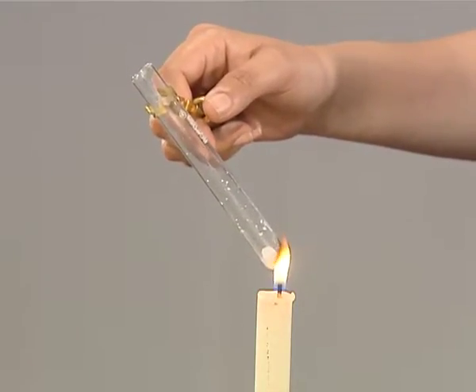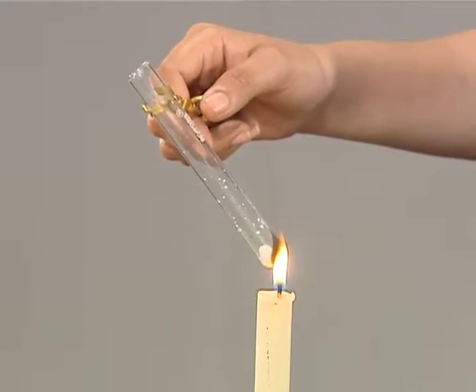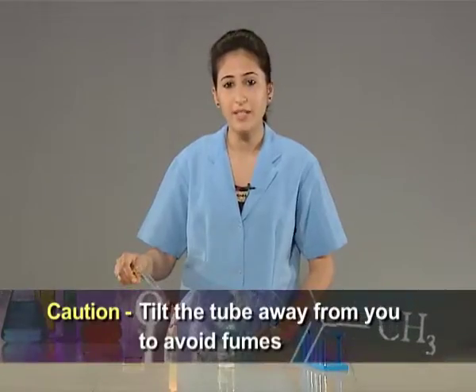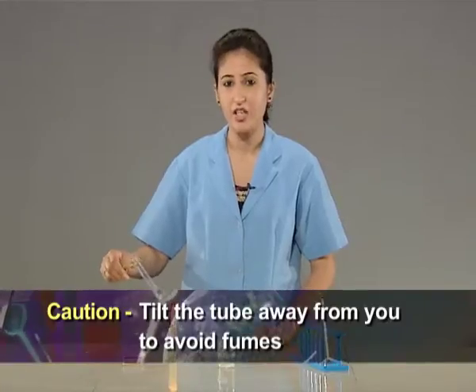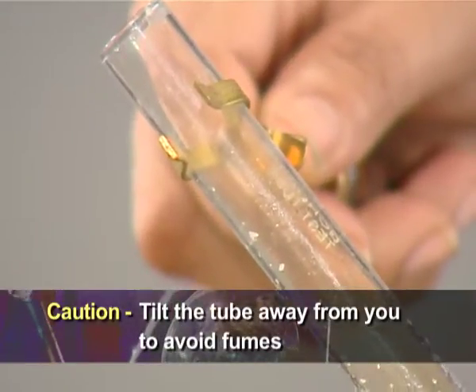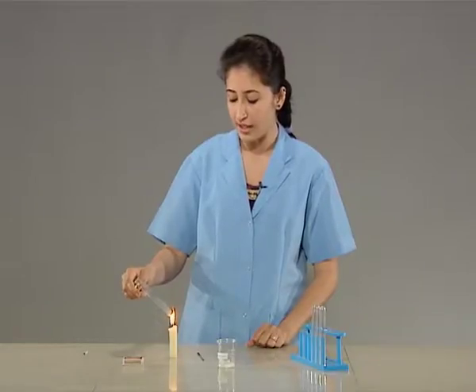Observe it carefully. Care should be taken to keep the mouth of the test tube away from your face to avoid the fumes. Observe it carefully.